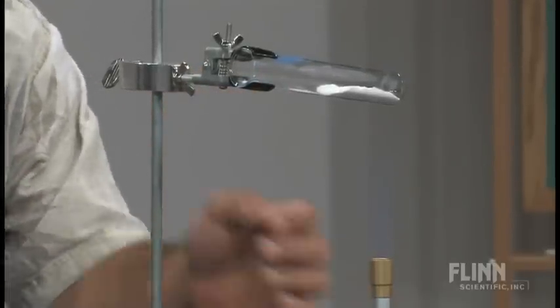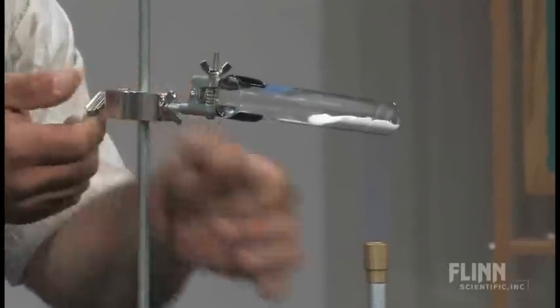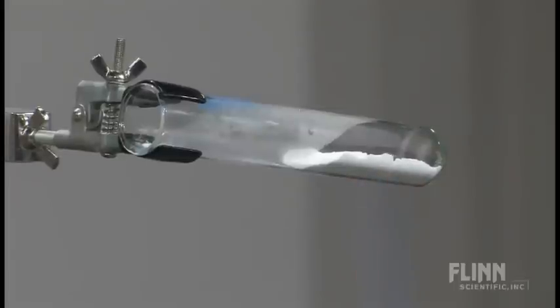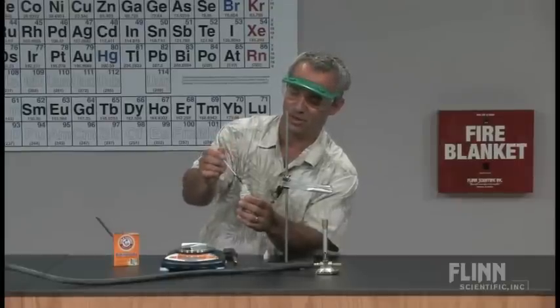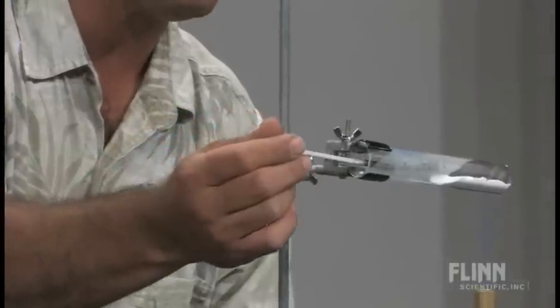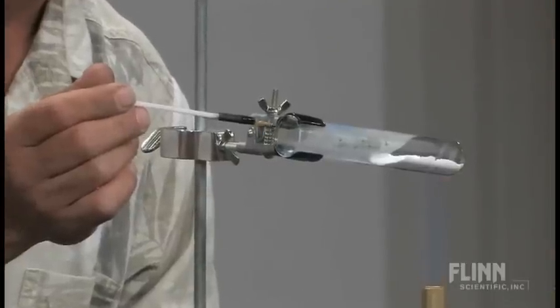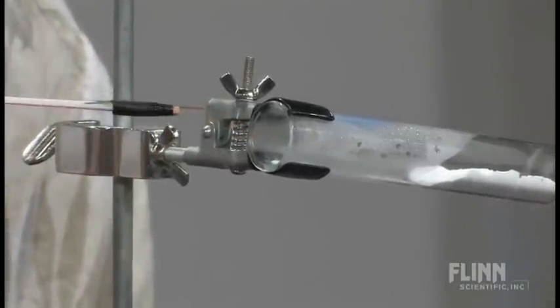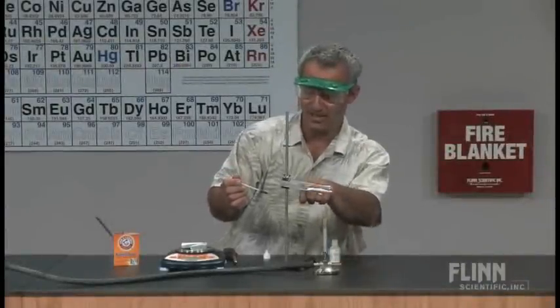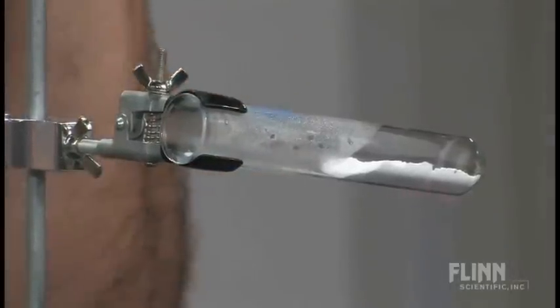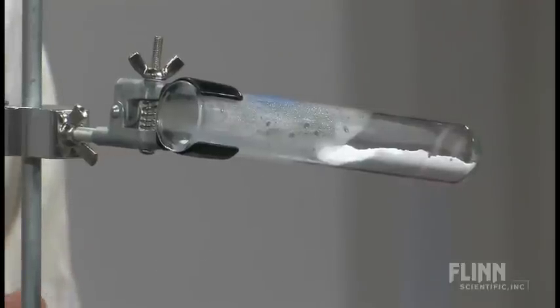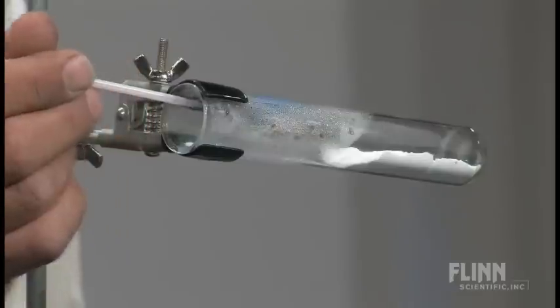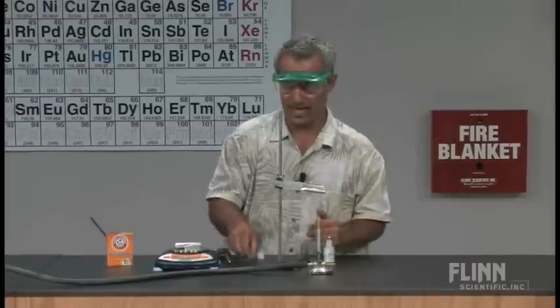Right away you can start to see some condensation in the test tube. You'll see more of that in a bit. The other thing, I've got some universal indicator and a little paint brush with some glass wool on the tip. I'm going to put a little universal indicator on the tip and put this inside the mouth of the test tube. And right away, do you see what color that turned? It went from a green to a yellow or orangish. They make note of that. That's a nice little acid change. So now we can see the condensation, there's plenty of water. I like to make these observations because they can figure out what the products are on their own. And there's some kind of non-metal oxide being given off here as well that's causing us to have this green to orange reaction of the universal indicator.